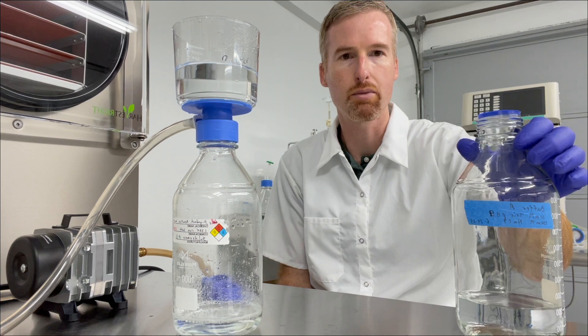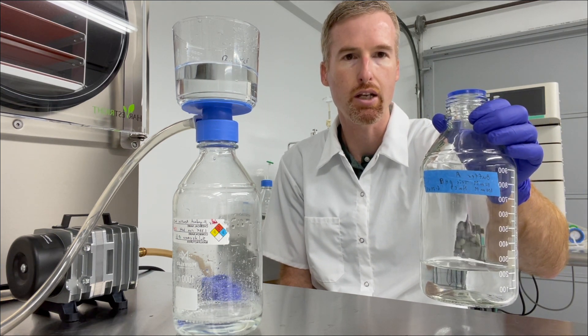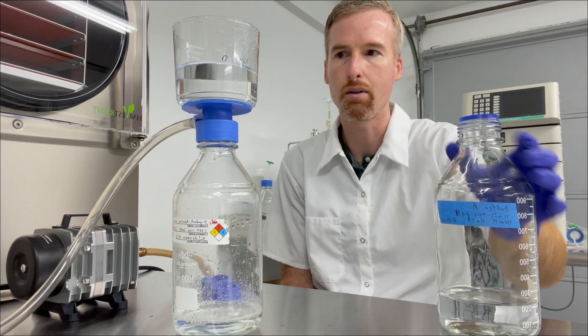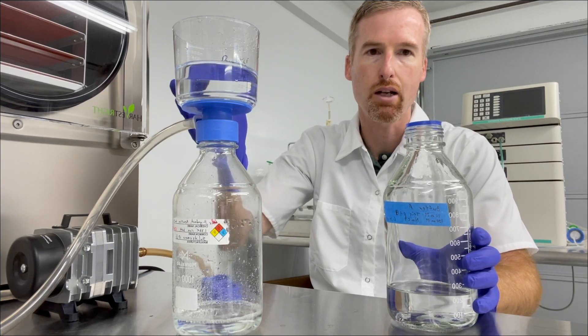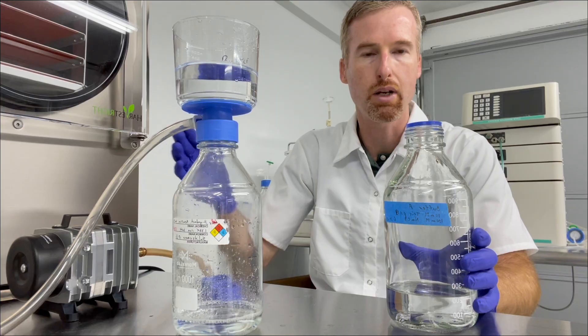So I've got here buffer A, this is 10 millimolar Tris pH 8 with 100 millimolar salt. I'm going to pour it into this Nalgene bottle-top filter which is connected to my aquarium pump.